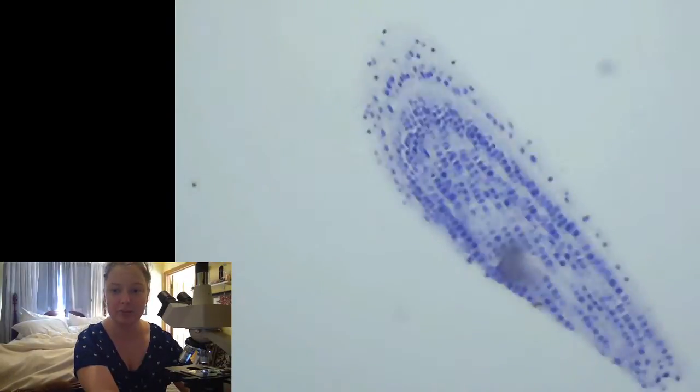So you can see me in the bottom corner, but you can't see. It should zoom up. So is it not working, the microscope camera? Where is it? I can't. Let me get it up to somewhere. Oh, it's mad at me. This is an adventure.